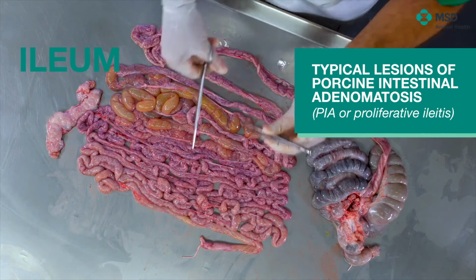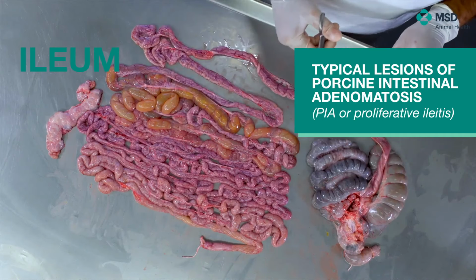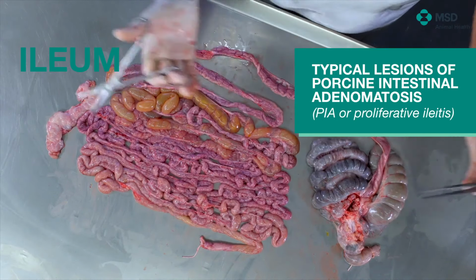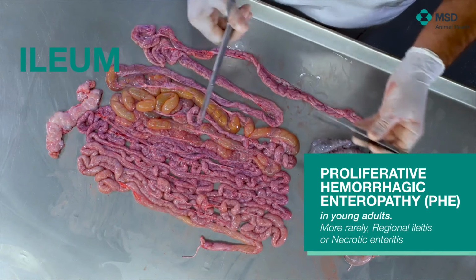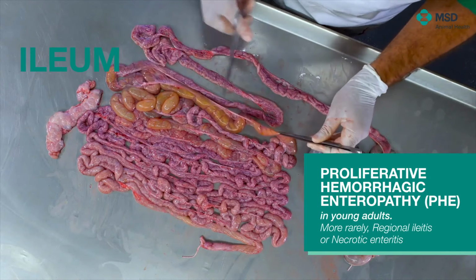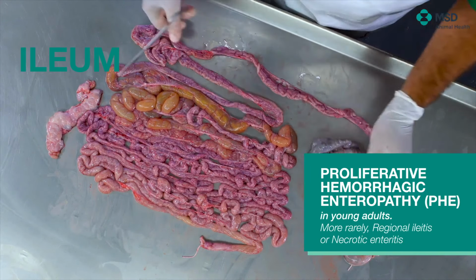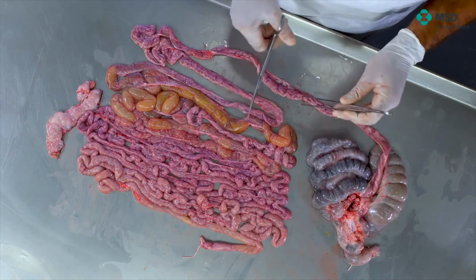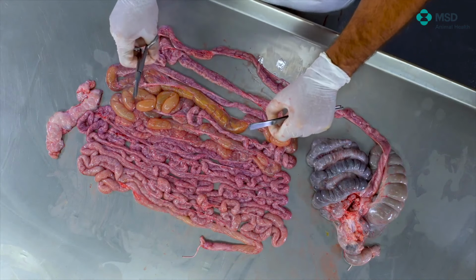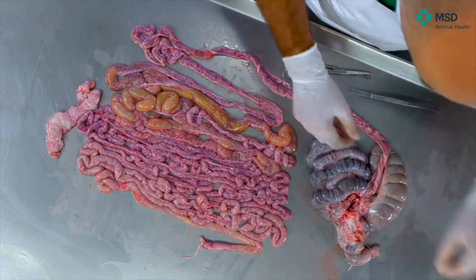So what we will do in terms of bacterial isolation, imagine for a while that we are expecting the possibility of colibacillosis, post-weaning diarrhea associated, and we are interested in isolation. So the recommendation is to take a relatively generous sample, 20-30 centimeters in length without any problem, to knot on the edges and submit such a sample.